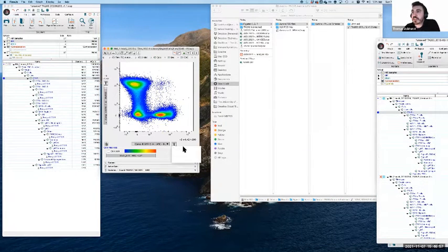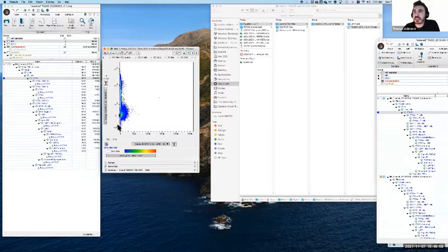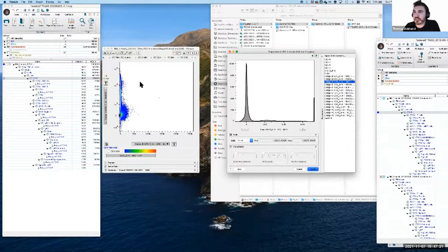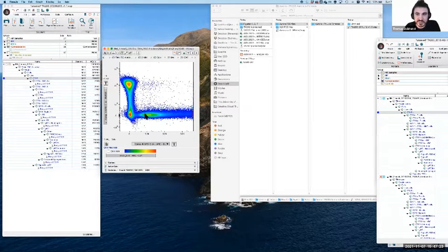Yeah, so some of these we can absolutely do, particularly looking at linear values, as in the question, particularly down near zero, where we're looking at where the actual problems are. Looking at data in a linear axis gives us a very different perspective on the data and on possible errors. One of the weird things about looking at data in a linear scale is you get a really granular appreciation of how biological data works.